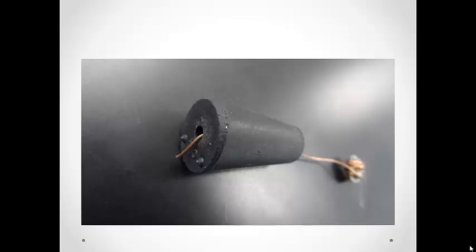Then thread the copper wire through the hole in the stopper and bend it down a small bit to hold it in place. You want the wire to hold in the stopper without slipping either up or down.